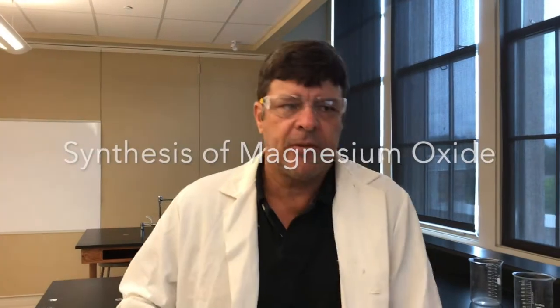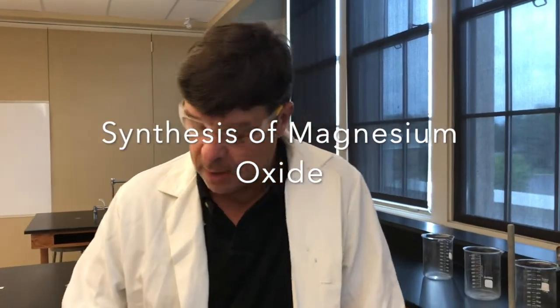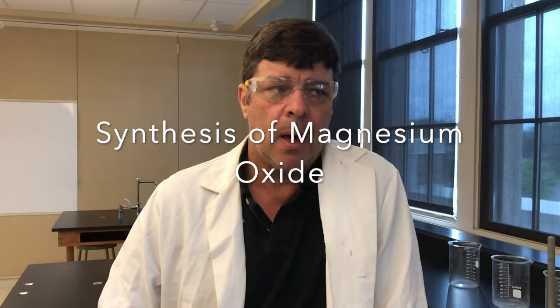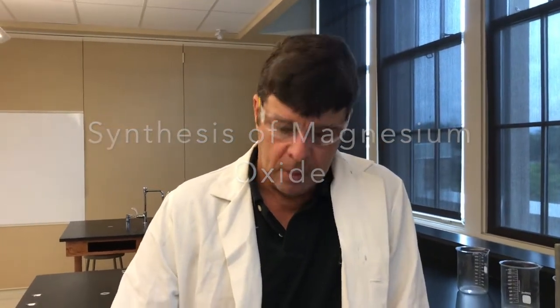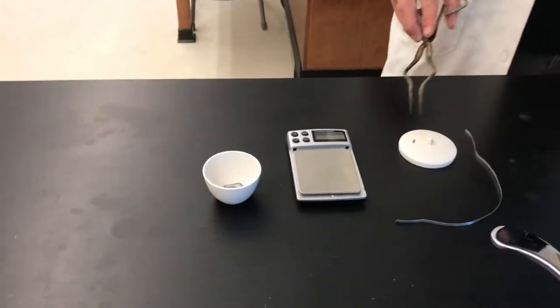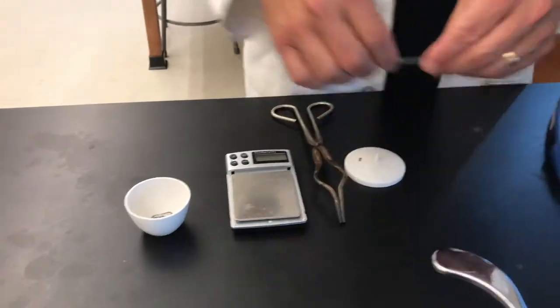We're going to burn some magnesium in a crucible today. This is a lab, and as you watch this, you're going to want to collect some data, and your teacher's going to have you do some calculations. So I just want to show you what we're working with. We have a crucible here, we have a crucible lid, a scale of course, and we have a piece of magnesium.